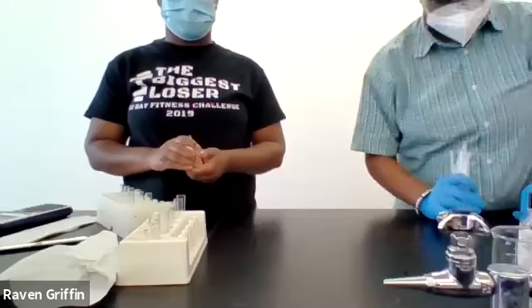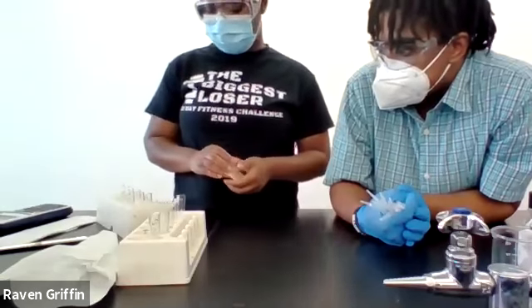I think as those pH papers sat, the oxygen and moisture in the air got to them, so they probably changed a little bit. But if you have your initial observations, you should keep those. Don't change them. That was just for the purposes of going back through the experiment. I know sodium hydroxide was dark blue, because that should be really basic, right? Whatever you wrote down initially, don't change it based on what we just did. That was just to make sure we had everything covered in the video, so when I upload it, you'll be able to know what happened.